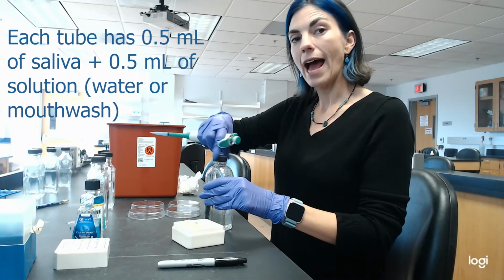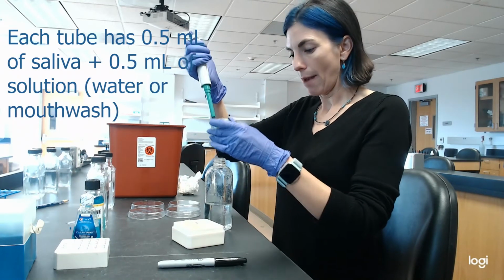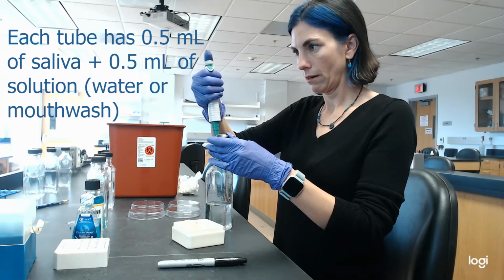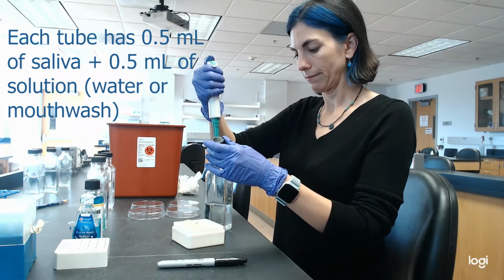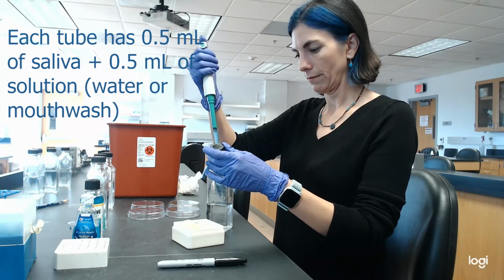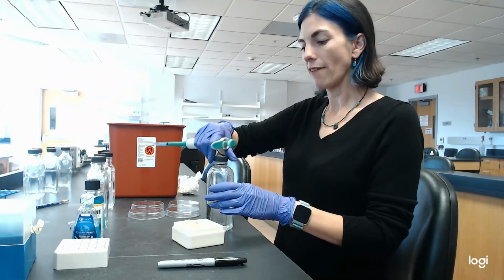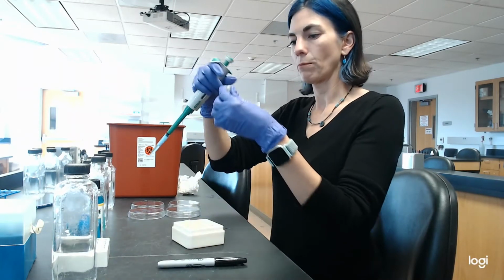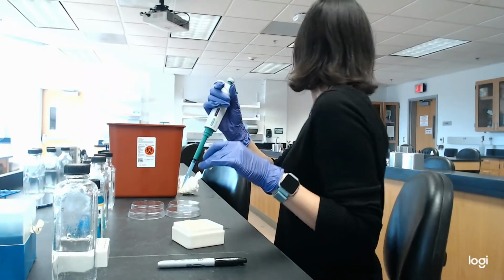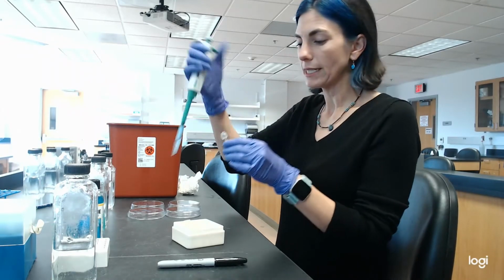I'm going to add half a milliliter, there we go. So I pulled out 500 microliters of water, and I'm going to mix it with my control and then time it for 30 seconds.